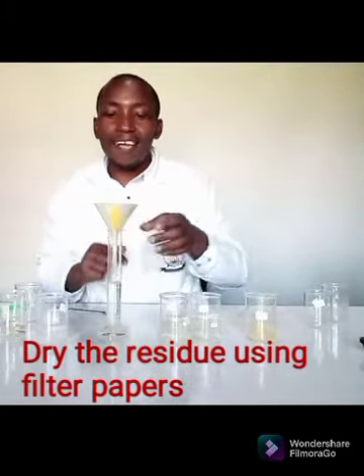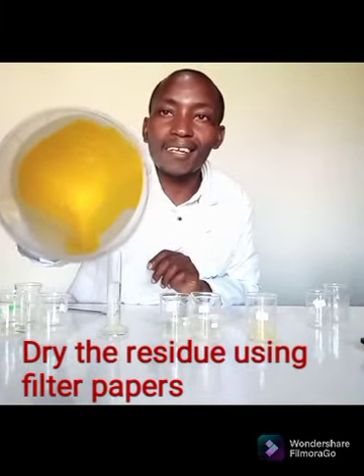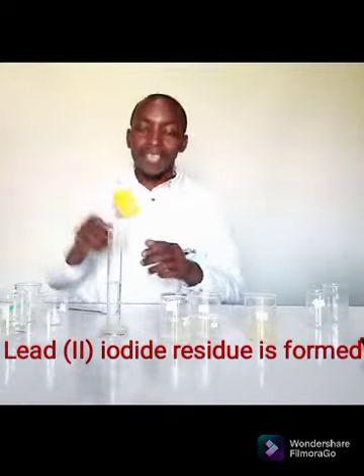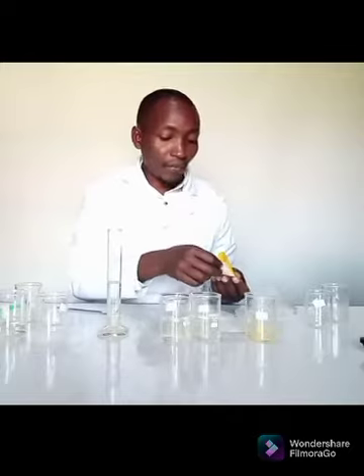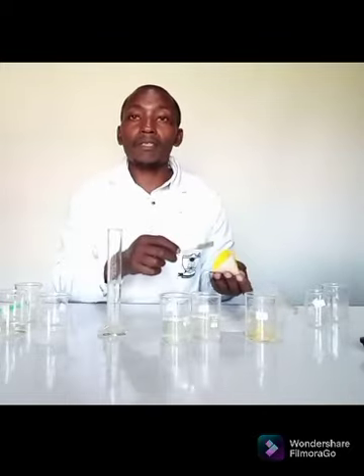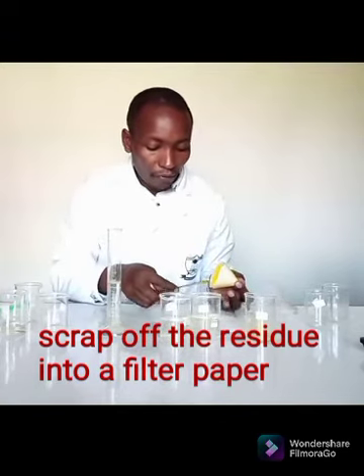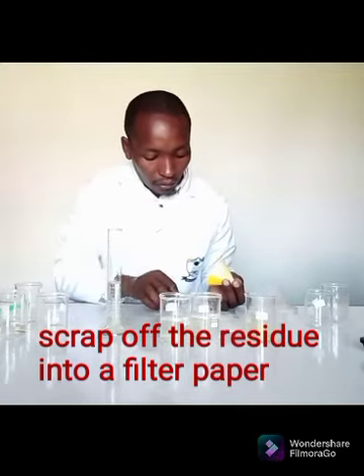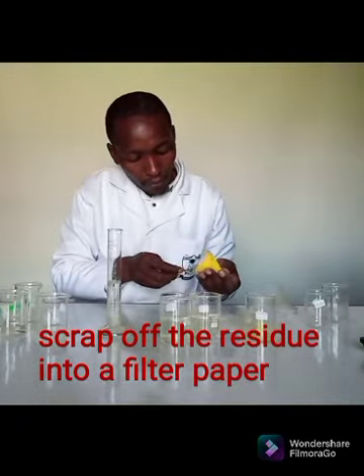Well, now after the filtration has taken place, you can see my precipitate is there, and the solid that I have there is lead II iodide. So what do I need to do? I need it to dry. So what I will do, I will scoop it from the filter paper, and as I scoop the solid, I place it on another filter paper.